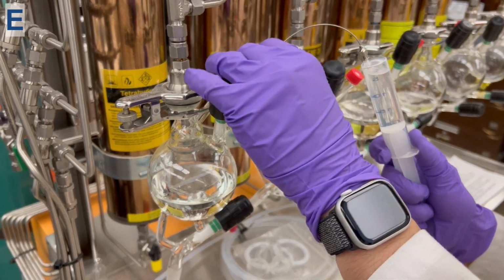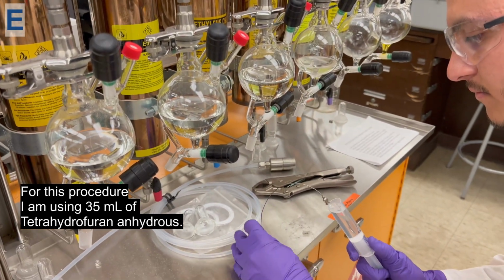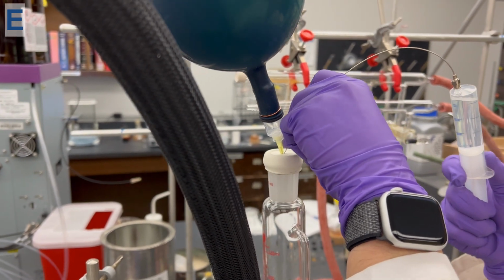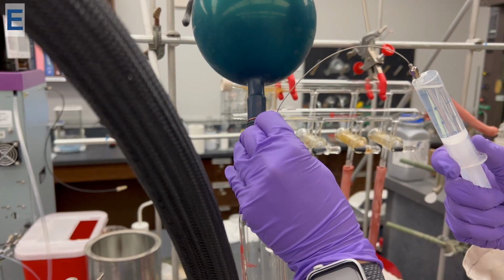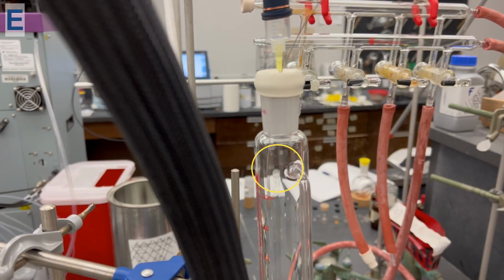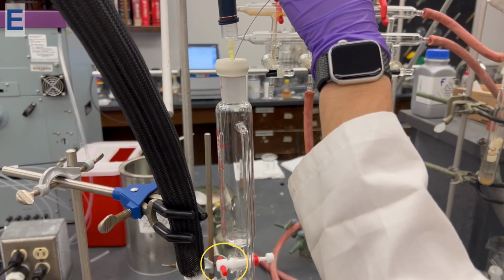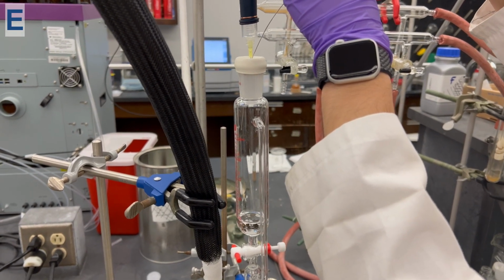Note that the solvent being used here is free of water for better product yield. Now, insert the needle into the rubber septa and fill the addition funnel. Make sure the needle goes all the way into the addition funnel and begin filling the addition funnel reservoir. Make sure the stopcock on the addition funnel is in the closed position when adding the solvent. Remove the needle from the addition funnel septa.